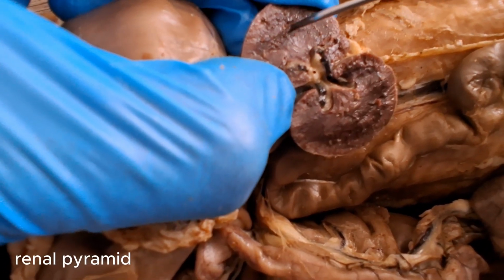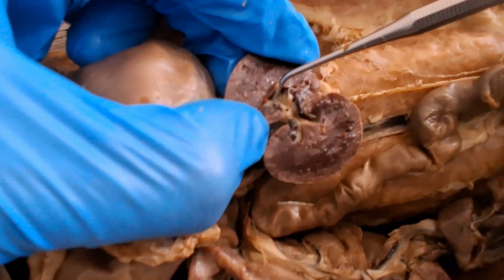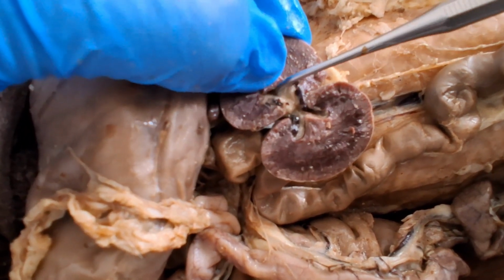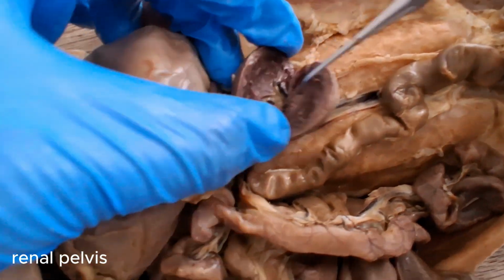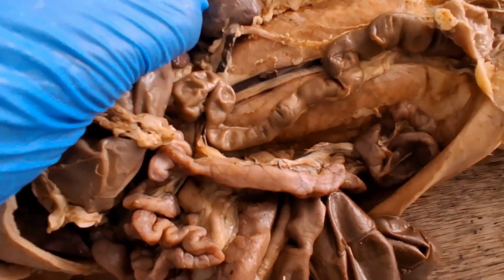In the rabbit as well as in the cat, there's only one renal pyramid, but in humans there are more. This cavity here is the renal sinus. That white expanded portion of the ureter is called the renal pelvis. That's this one, the ureter. But that's the expanded proximal portion of the ureter, the renal pelvis.